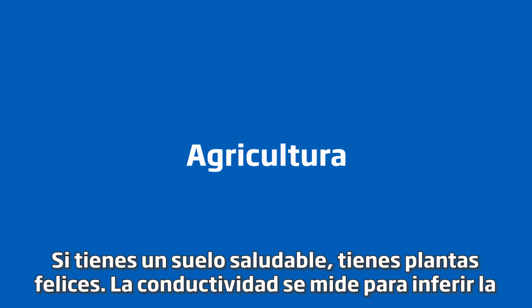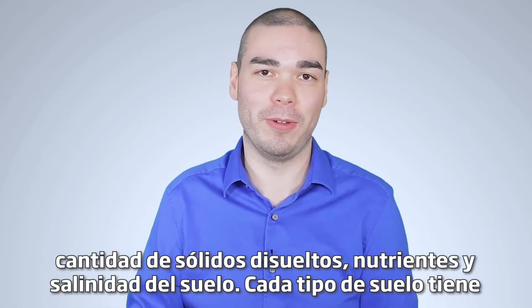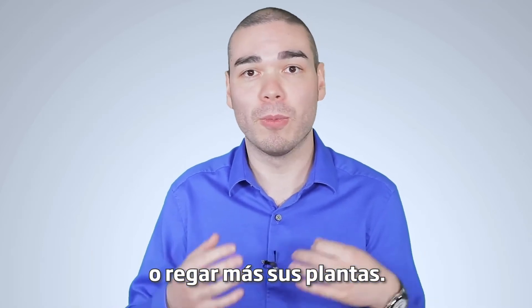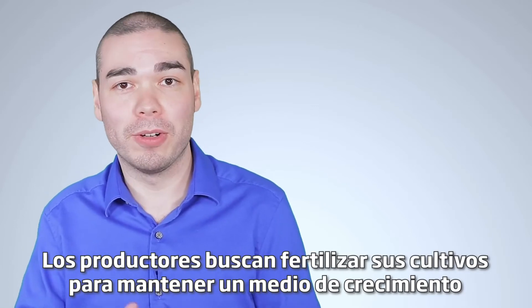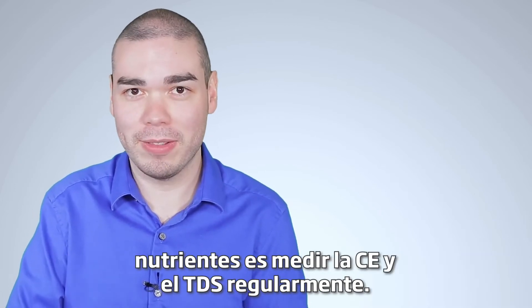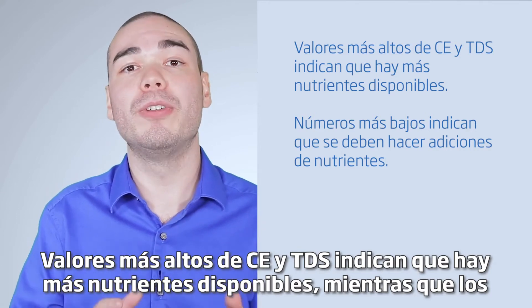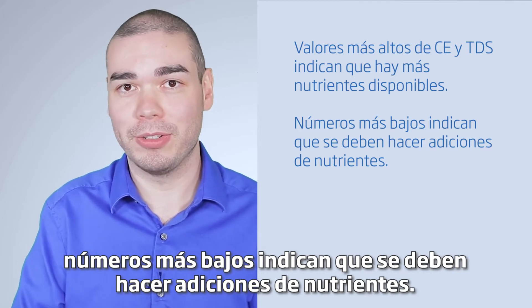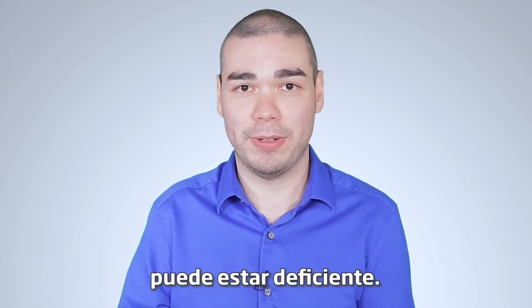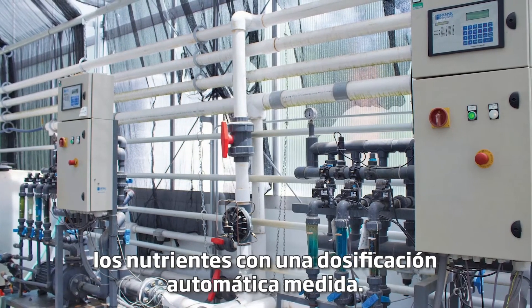If you have healthy soil, you have happy plants. Conductivity is measured to infer the amount of dissolved solids, nutrients, and salinity of soil. Each type of soil has unique EC properties, but it's a good way to tell if you need to fertilize or water your plants more. When growers are looking to fertilize their crops or to maintain a growth media, it's a fine balance between the nutrients. A great way to monitor these nutrients is to measure EC and TDS regularly. Higher EC and TDS indicates there are more nutrients available, while lower numbers indicate that nutrient addition should be made. Remember, this number is nonspecific, so it won't tell you which nutrient may be deficient. Irrigators help to have a precise and efficient way to monitor EC and adjust the nutrients with measured automatic dosing.